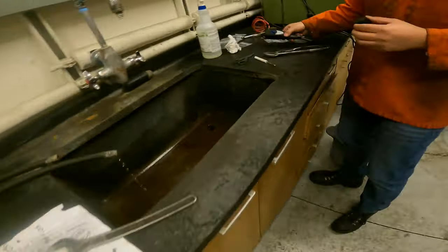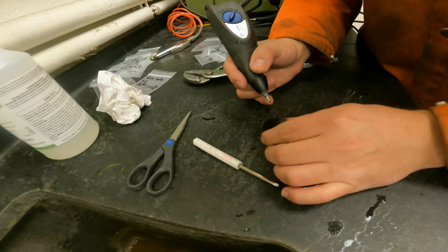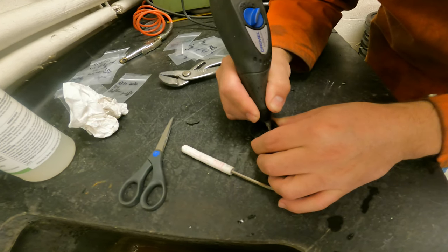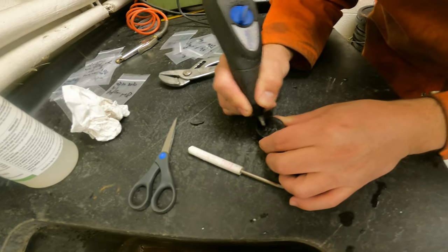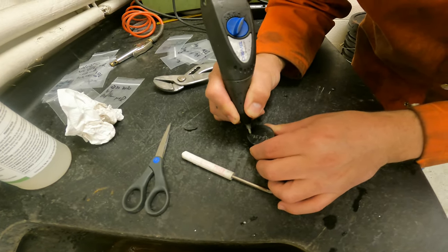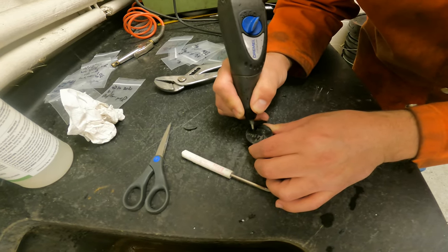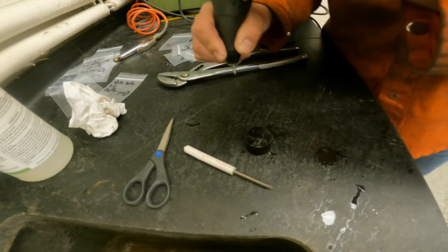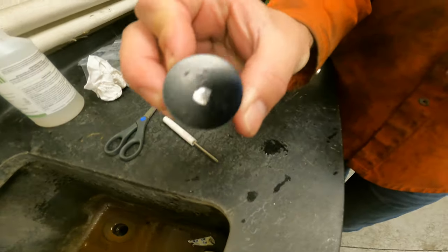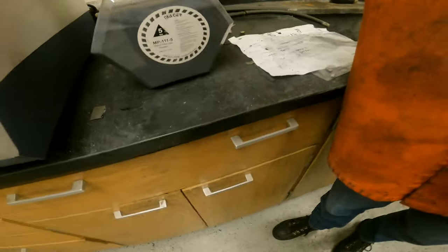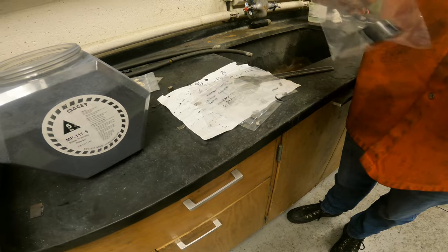The last step is labeling before we forget. So we use the engraver to identify the sample. That's it, we have our first sample. Make sure you place it to keep everything in the same place in the back. We're done with the first sample.